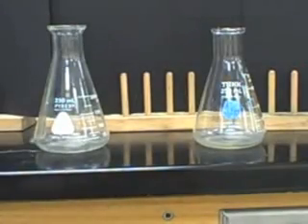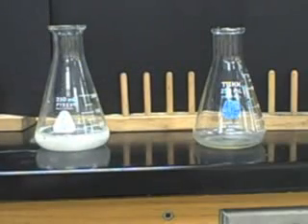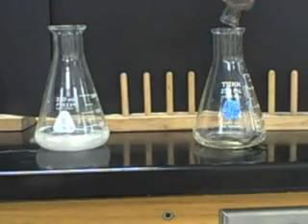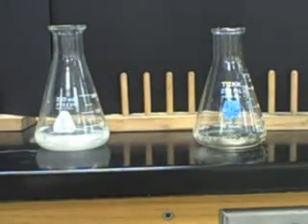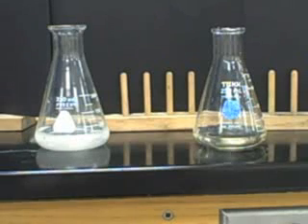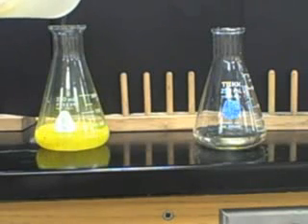So this is for the grand finale. We've got lead nitrate into a flask. And now we're going to do silver nitrate in another flask. A little bit of a spill there. I'll have to clean that up. And then for this one, add some potassium iodide to the lead nitrate for the awesome yellow precipitate. Look at that.